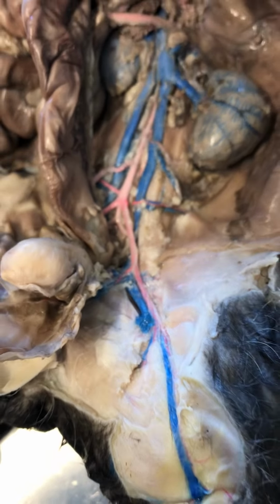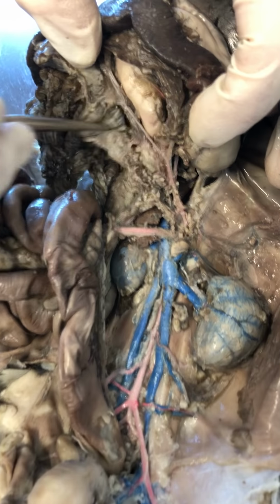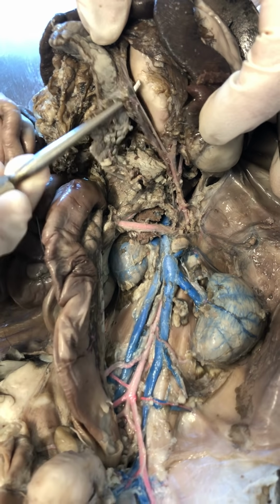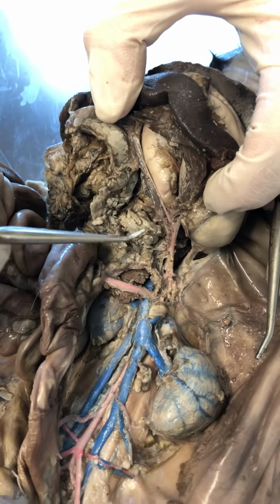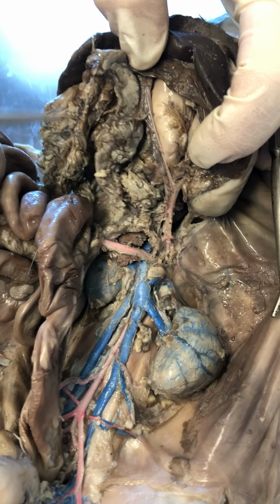Okay? So then for the veins, there's something called the hepatic portal vein. Okay, in this cat, it's not dyed. Okay, usually it's yellow, but see this purple vein right there? See that? So that's part of my hepatic portal vein. Okay, so it actually starts back near the liver. It comes up and then it branches up towards the stomach and spleen as my gastrosplenic vein.